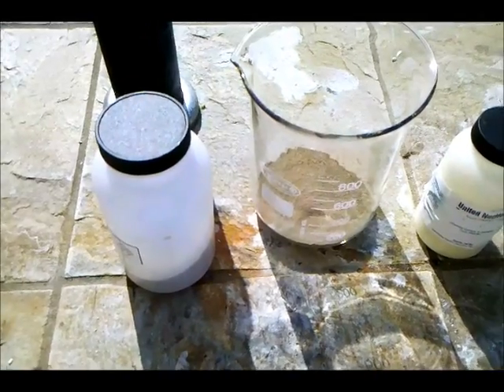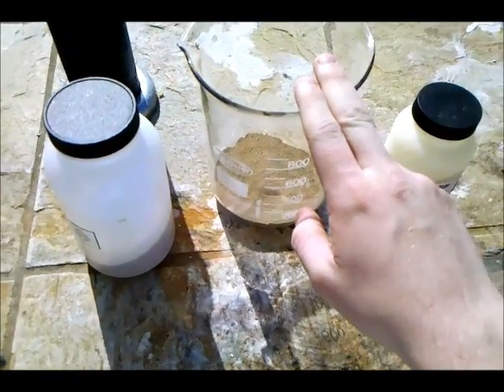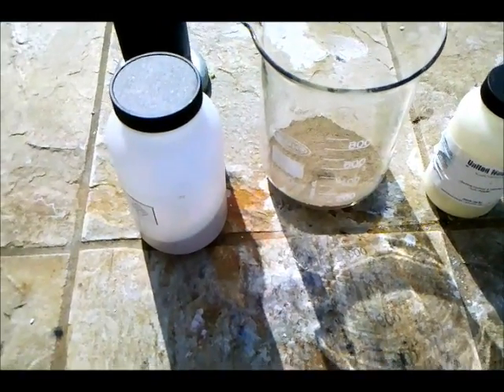The ratio is 12 units of sulfur combined with 9 units of silicon dioxide, which combines with 10 units of aluminum by weight.